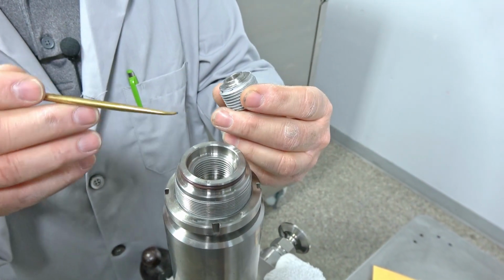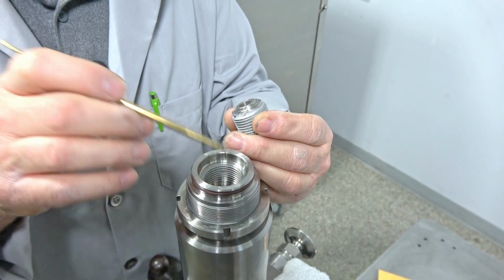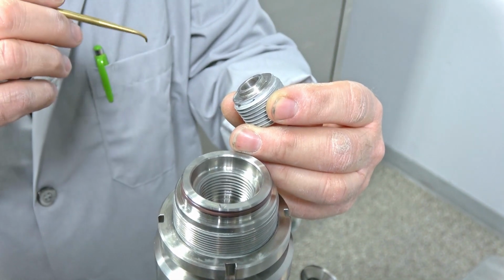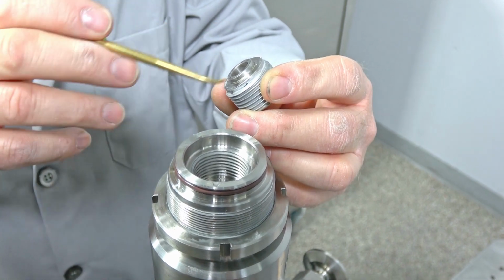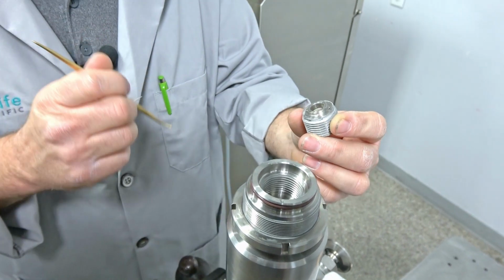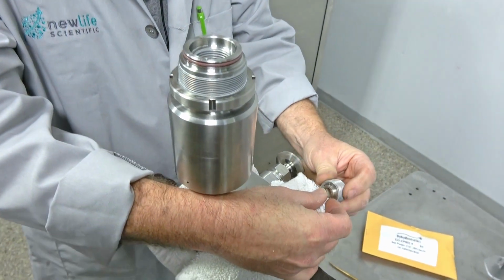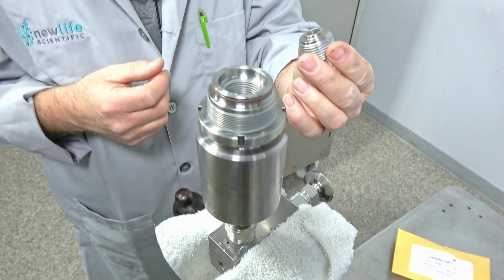So if you get in here and you notice any debris in this area, you definitely need to clean it. But because this machine is so new, this one is extremely clean. It's had very little use, so there's no debris. But you'd want to clean all the debris off, and I'm just going to wipe that edge off right there, because this is producing a high pressure seal here.